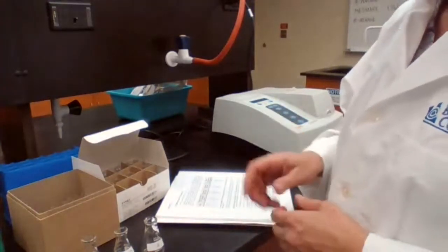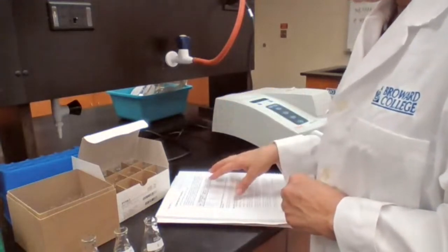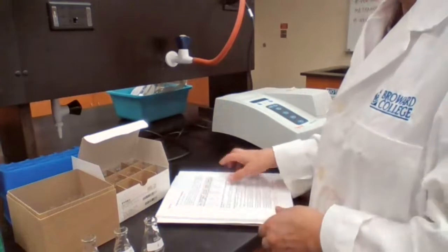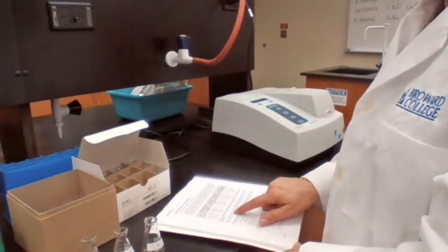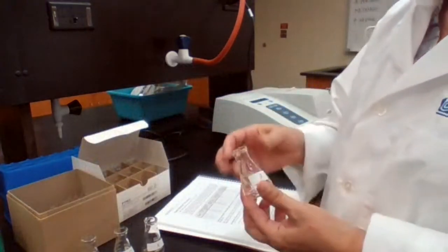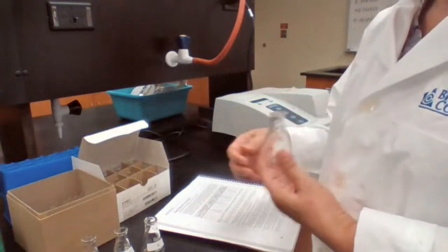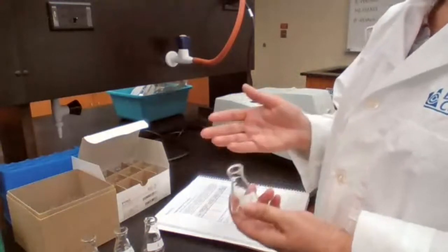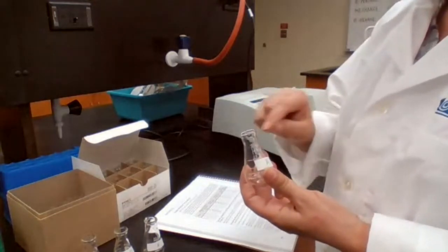A direct pipette is more practical because we can use different increments of volume. We are going to follow the table provided in the procedure to fill up the flasks. Flask A is going to serve as a blank. We are using a blank because we want a reference for zero absorption — the blank will not have the active ingredient, so it will have zero absorption.